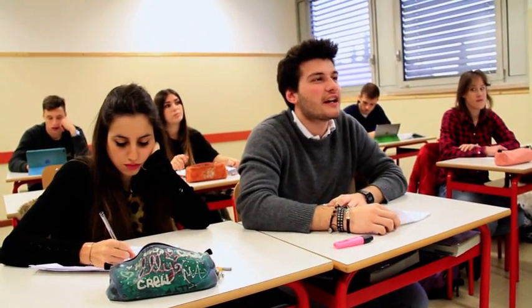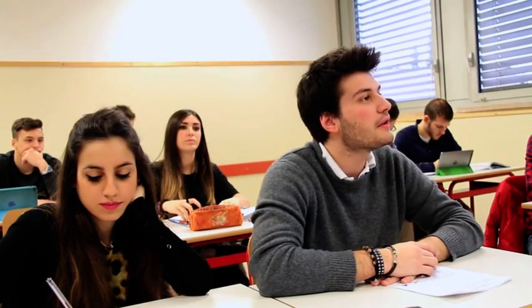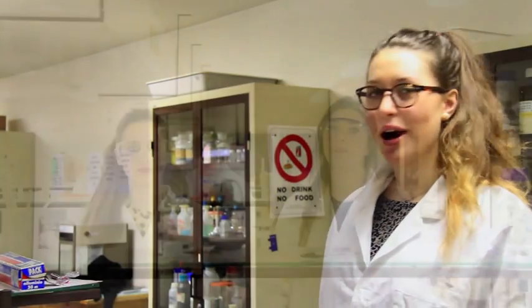Miss, can we make an aspirin? Yes, of course, it's a simple reaction. Can we go to the lab? Yes, it's a really good idea. We can do it in the lab. Let's go now. Before we start, let's have some information about this compound.